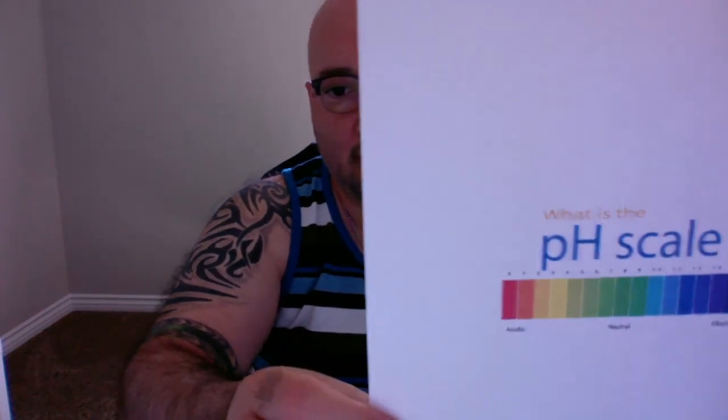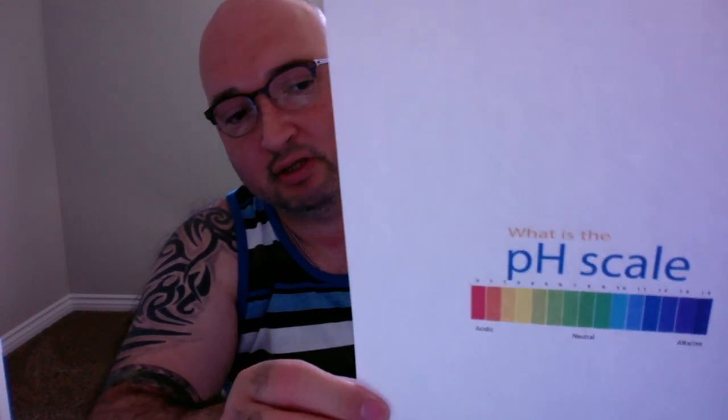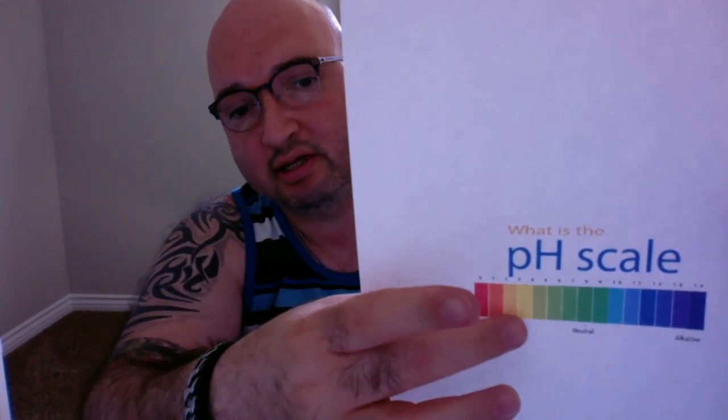I know this is acidic because if we look at the pH scale, which is right there, that yellow color is on the lower, acidic end. Now, one thing not to be confused about here is that red does appear on the acidic end as well, but phenol red is red in its unaltered nature.